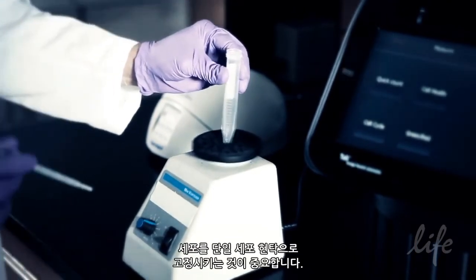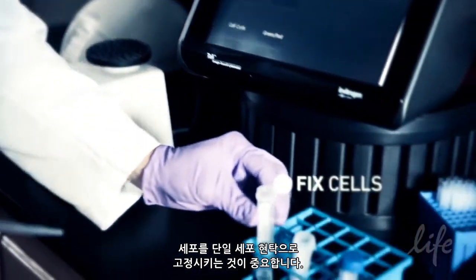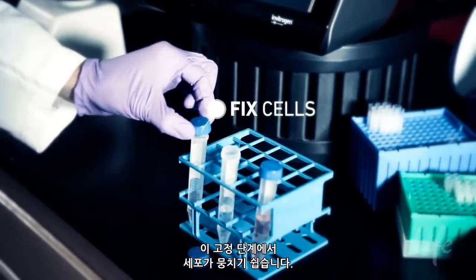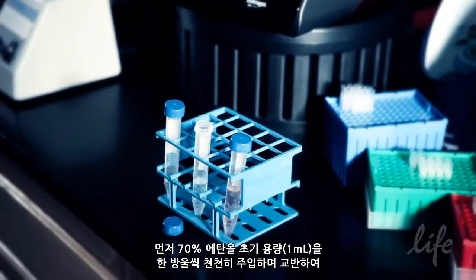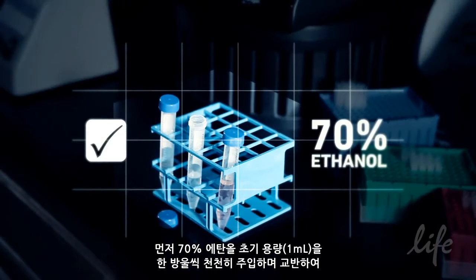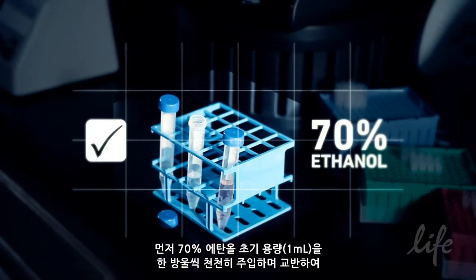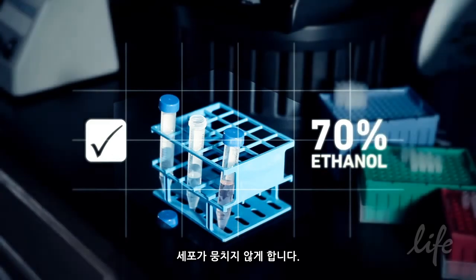It is very important that cells are fixed into a single cell suspension. Cells tend to clump during the fixation step. The very slow drop-wise addition of the initial volume of 70% ethanol — first 1 milliliter — while gently vortexing, will help prevent cells from clumping.